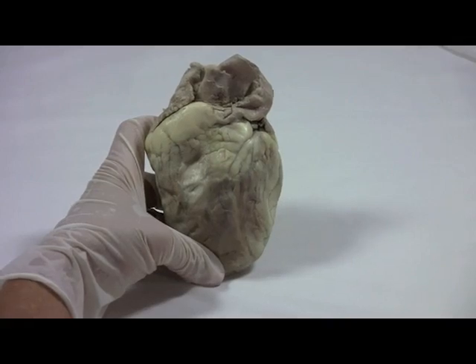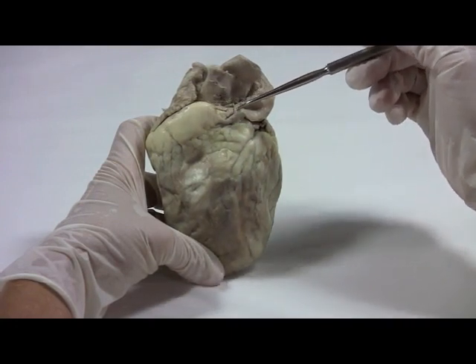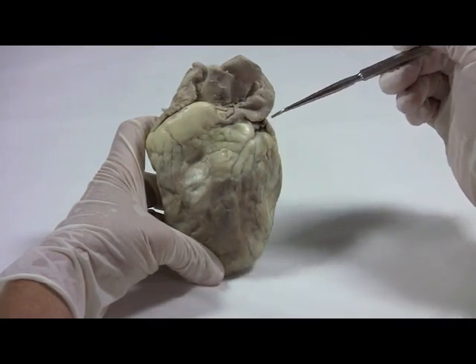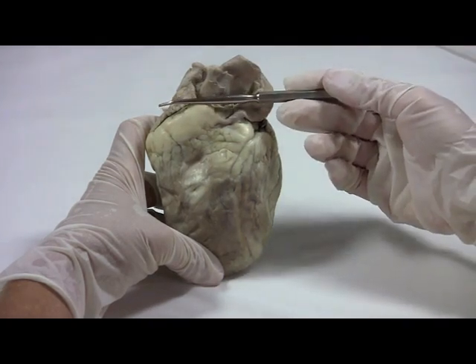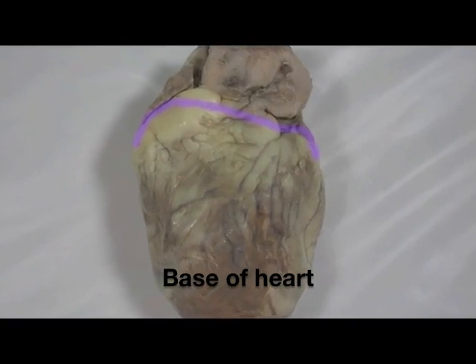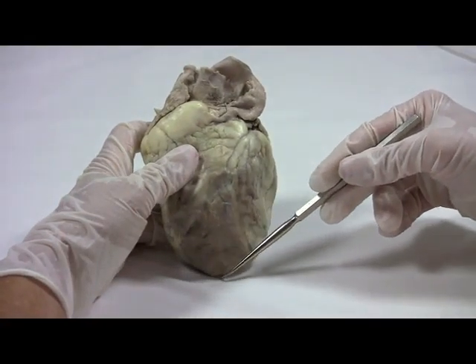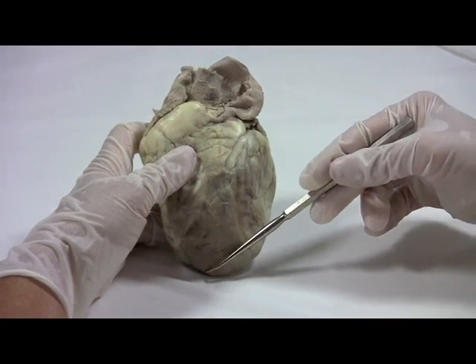Let's take a look at the outside of the sheep heart. This is the superior part of the heart. It's called the base. It's the widest portion of the organ. It is unusual for the base to be at the top of an organ. And the inferior part of the sheep heart, where it comes to a point, is called the apex.